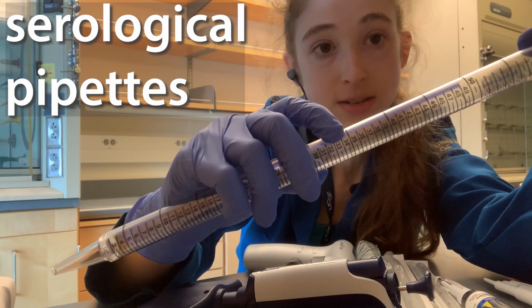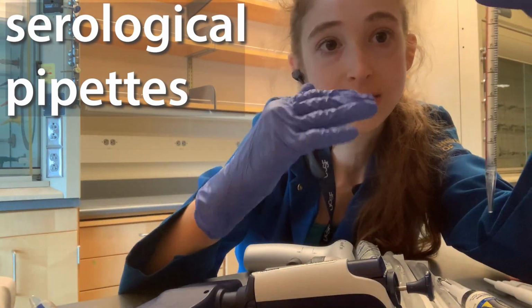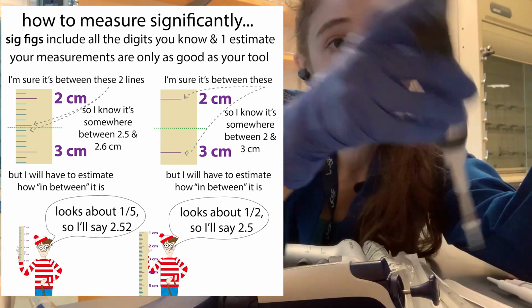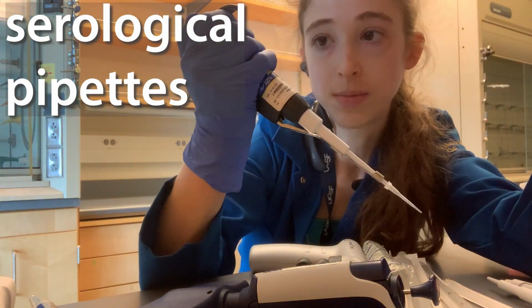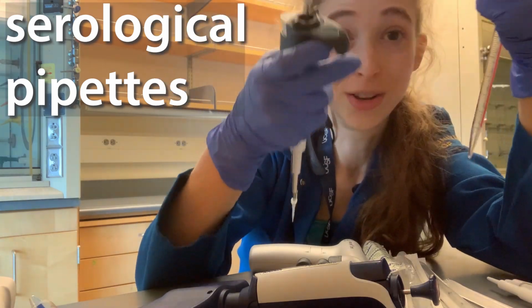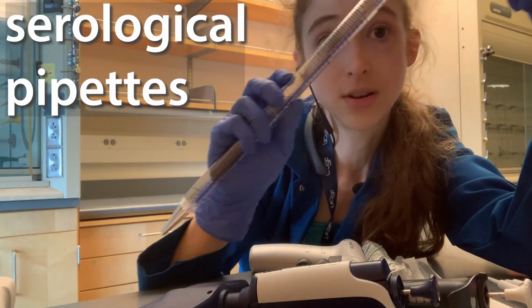So each of these lines is only 1/2 of a milliliter. These lines are going to be serving as your guideposts when you're trying to measure. Unlike the micropipettes, where you adjust the dial and it tells you, okay, you stop here, it'll set the volume basically. But with one of these, your job is to set the volume based on these lines.